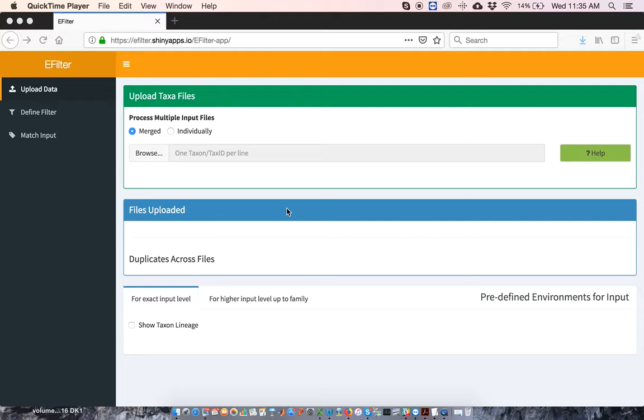The first step is to upload your data. Data should be in the form of text files. Specifically, you want to upload lists of taxa from your metagenomics samples. These lists can be tax IDs or Latin names, and Latin names can be at any taxonomic rank. In fact, you can upload lists of mixed rank. So for instance, you can upload lists that include families, genera, and species.